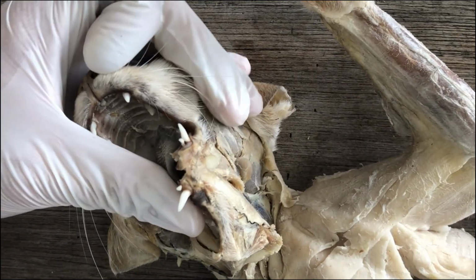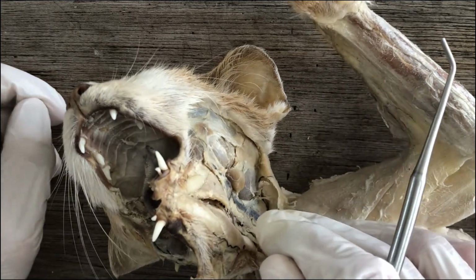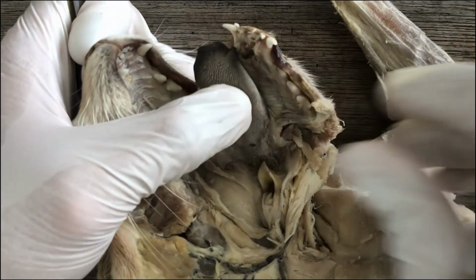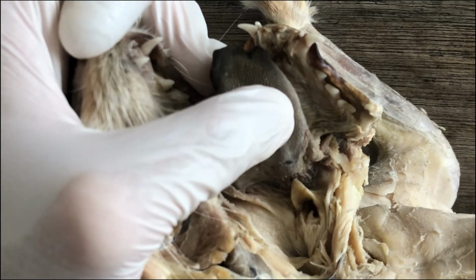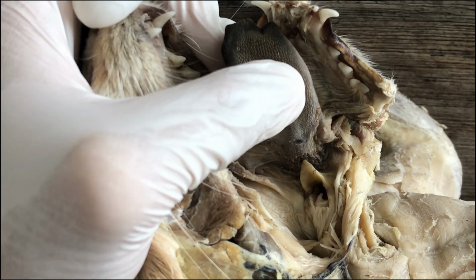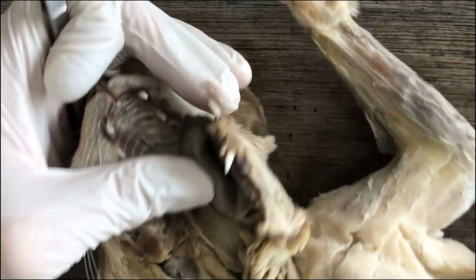There are true and false vocal cords, but it's better to study and differentiate them during face-to-face activities, as they are difficult again to show in the camera. It's dark down there, but there are folds partially blocking the glottis. Those are the vocal cords.